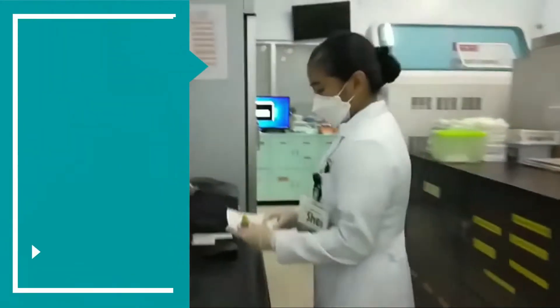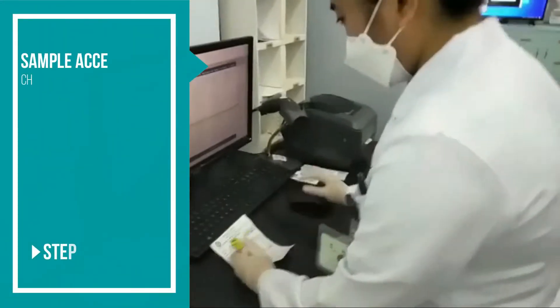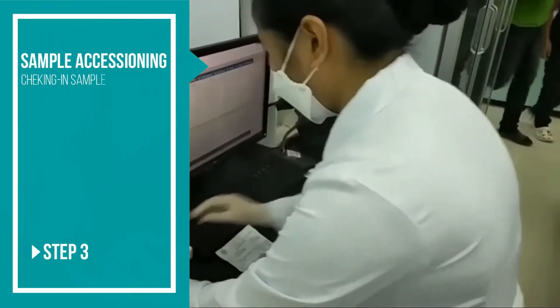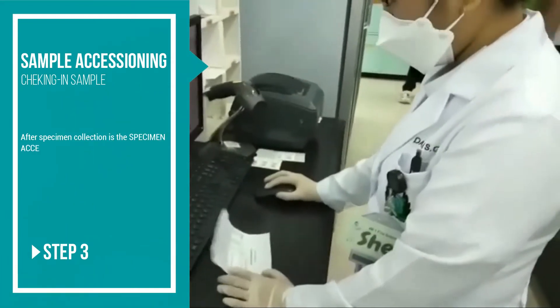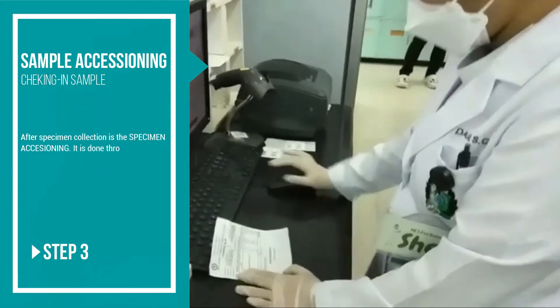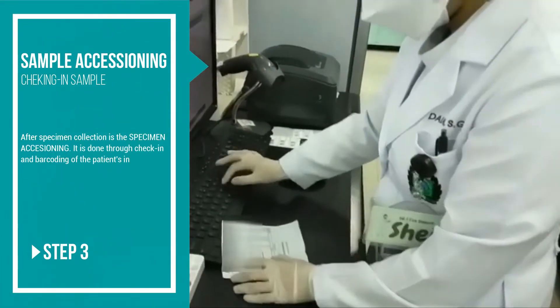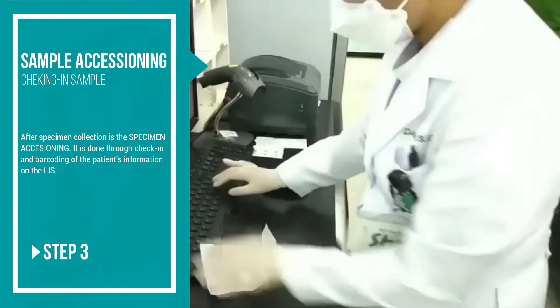After specimen collection is specimen accessioning. It is done through check-in and barcoding of patients' information on the laboratory information system.